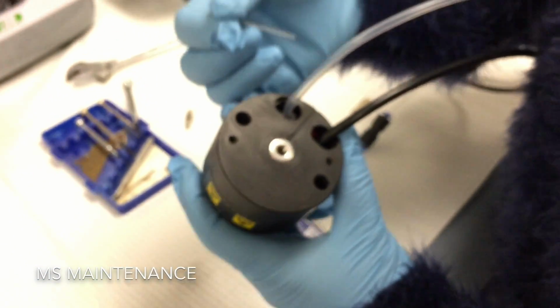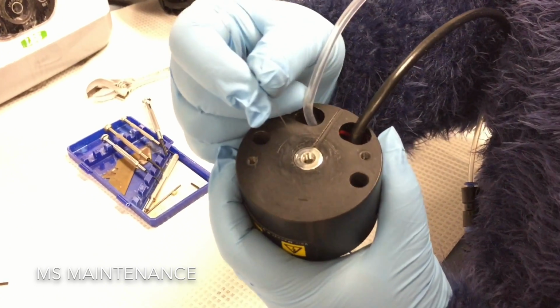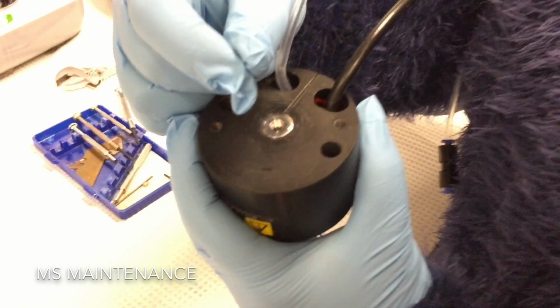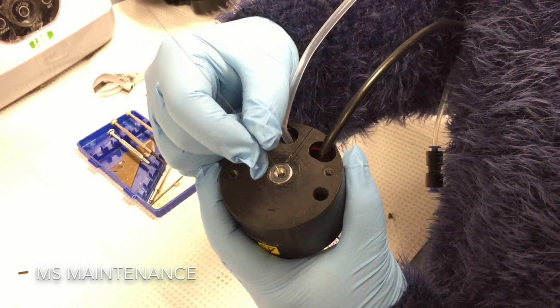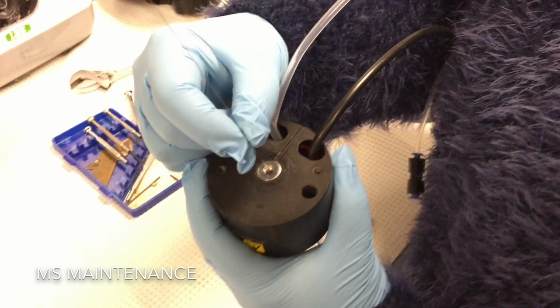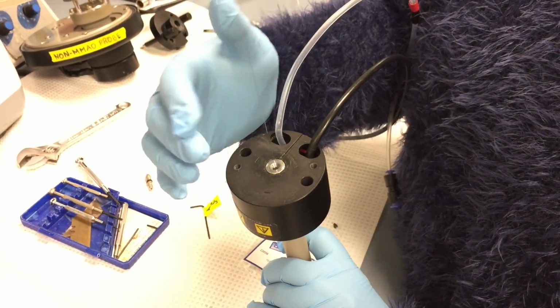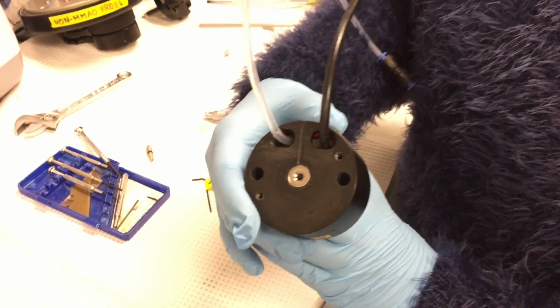So the first thing I'm going to do is insert this capillary into the inner hole of the conductive sleeve, and I need to do it in such a way that I'm not going to puncture the sleeve. So I want to make sure I can get it into the hole. So now the capillary is inside the sleeve.